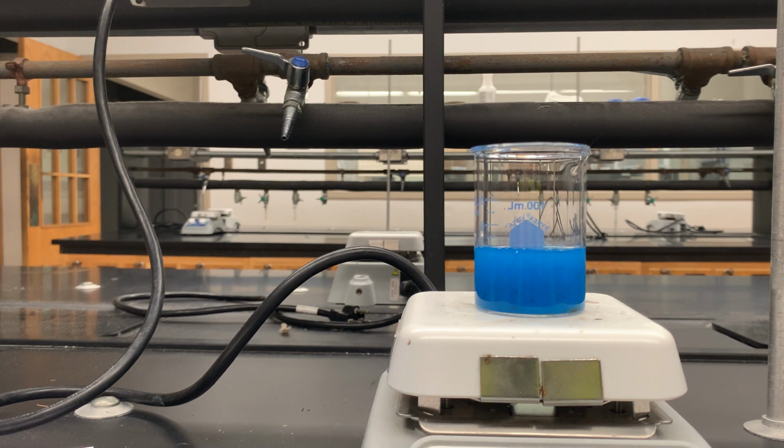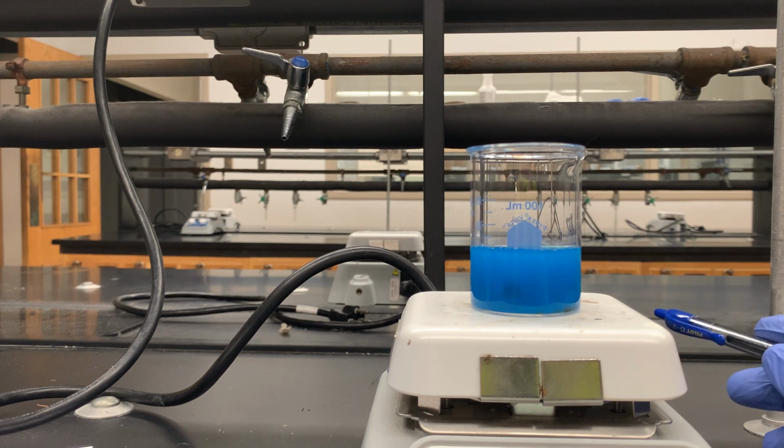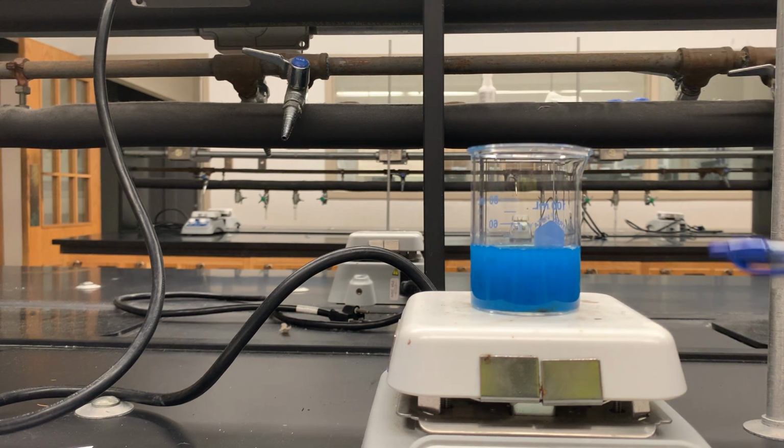What you do not want whenever you're heating something is for something to basically stay at the bottom and not move, because then it just creates these little pockets of heat, and then those pop, and that can be dangerous. As you can see though, I'm going to turn this gently. There at the bottom, these dark powders, or these dark solids, are forming.